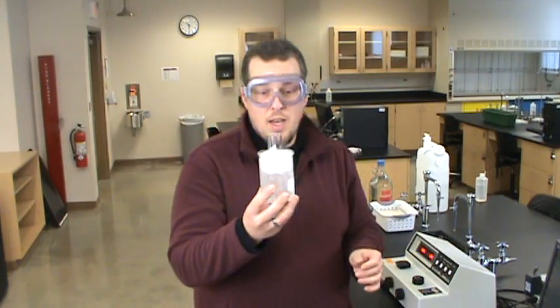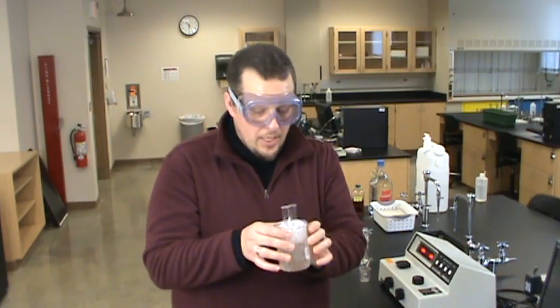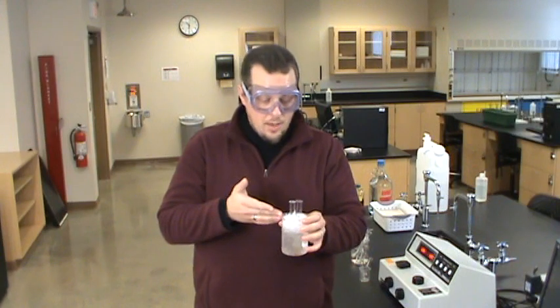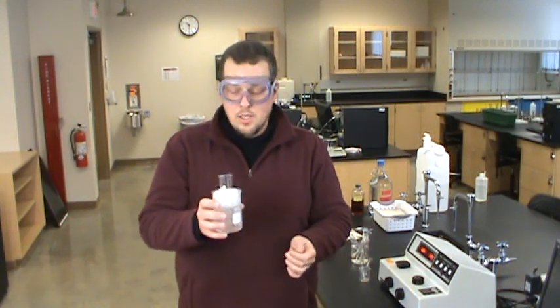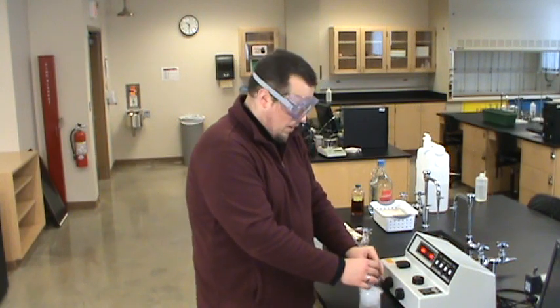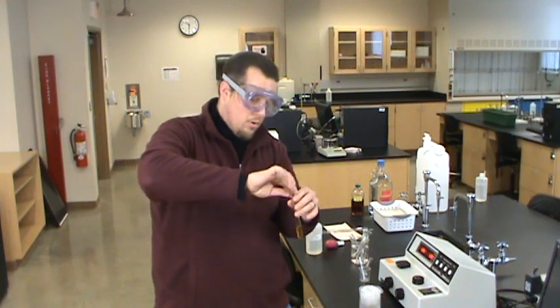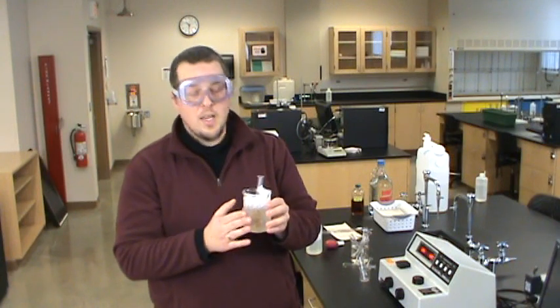All right, these have been in the ice bath for about 10 minutes, so everything should be plenty cold at this point. Now what we need to do is mix them together and watch the reaction. In this case, because the reaction is so slow, we can actually follow this just by using the clock on the wall or by using your watch. This reaction is probably going to take up to about an hour, 20 minutes. So once everything is cool, we need to be ready to mix. We can take things out for a brief amount of time just to mix them back and forth, but make sure you get those back in the ice bath as soon as possible.